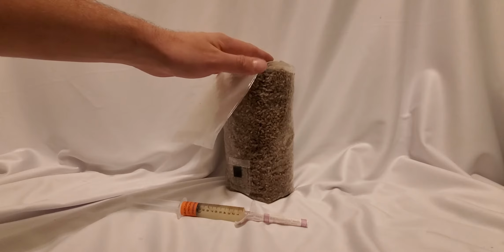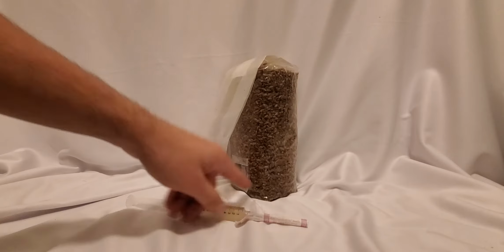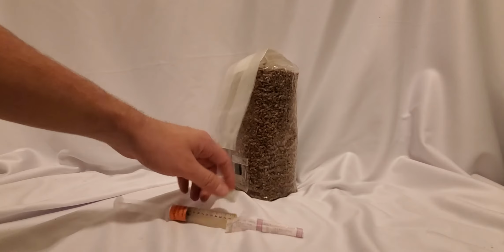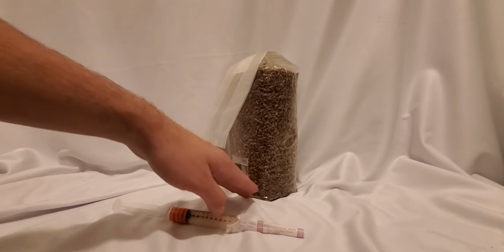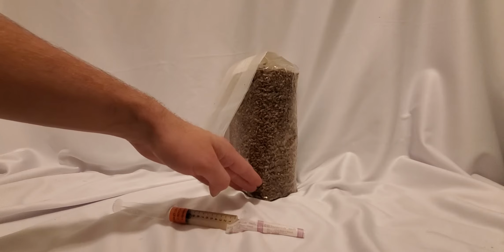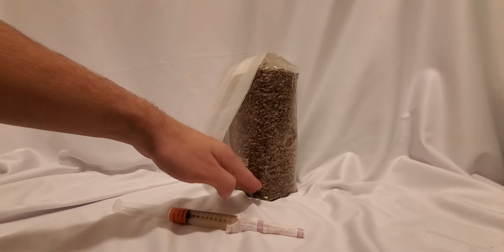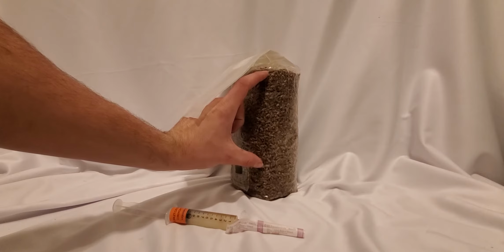A lot of people will inoculate the bags while the bag is in this position. The injection port is near the bottom, and when you insert the liquid, it goes down and it pools at the bottom. This causes slower colonization, as not only is the liquid pooling in the bottom, which is undesirable, but the mycelium has to grow all the way up through that much material.